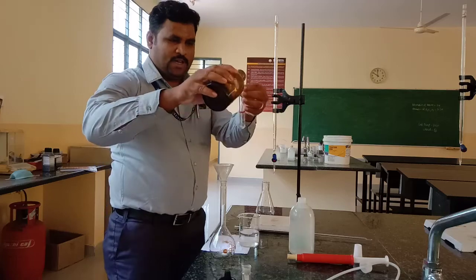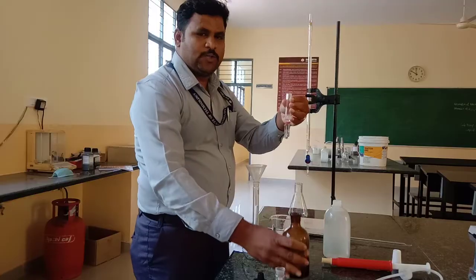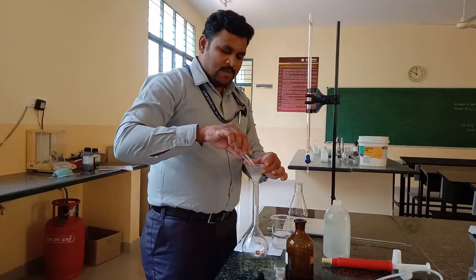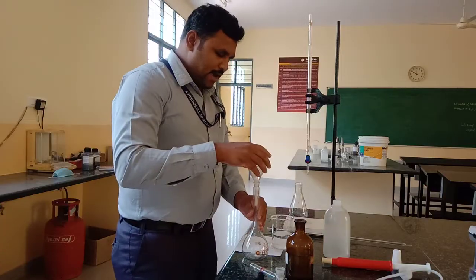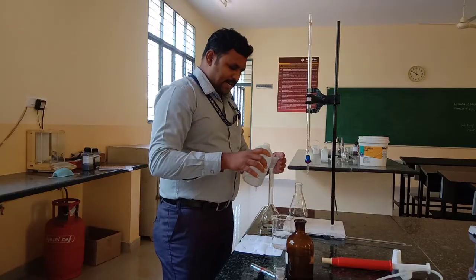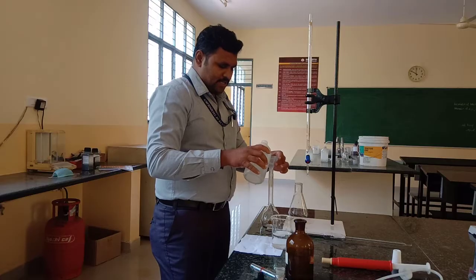The role of ammonia is to increase the rate of dissolution of the salt. After adding ammonia, add DM water — demineralized water, also called ion exchange water.